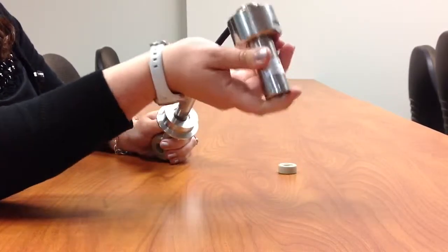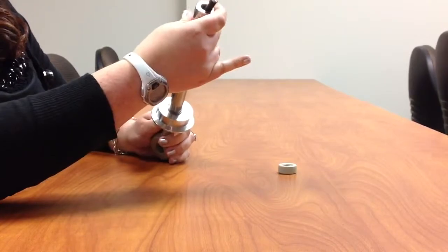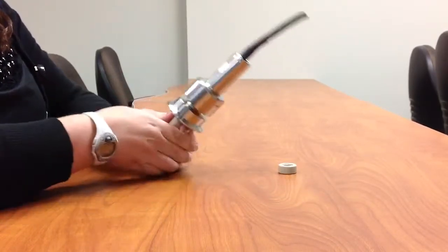Now you take your base, the top piece of it, and this is the part people have the most problems with because there's two steps to actually threading it in.